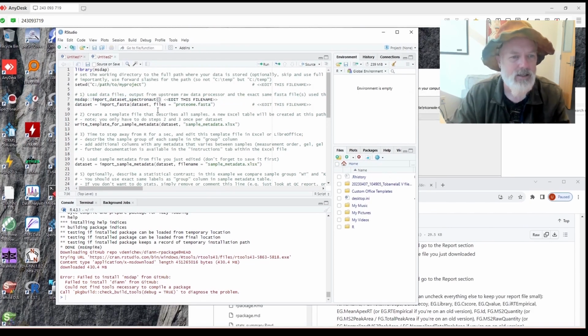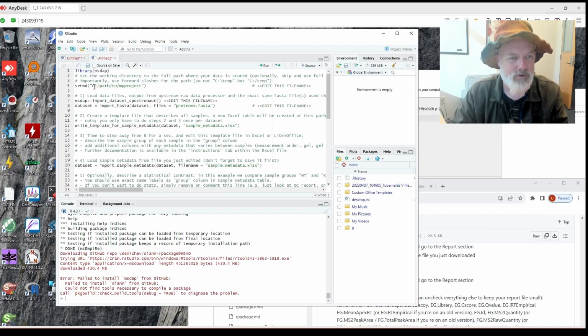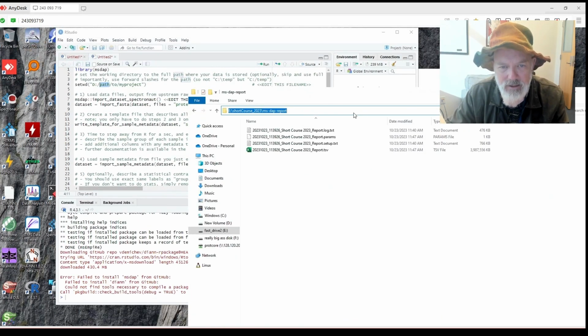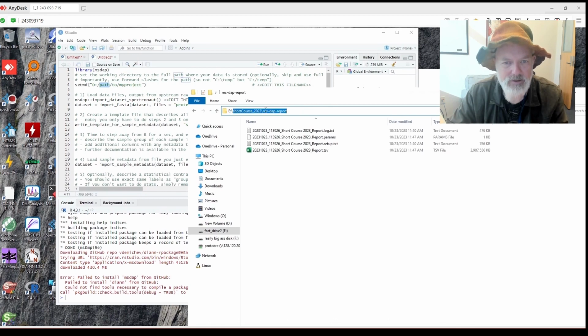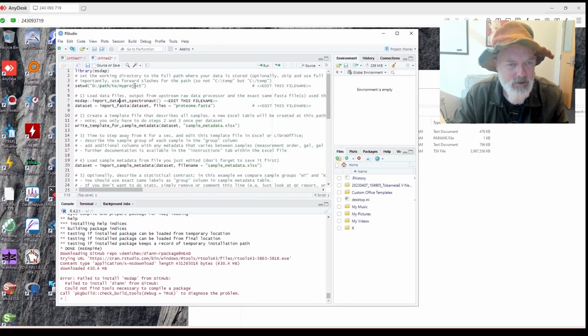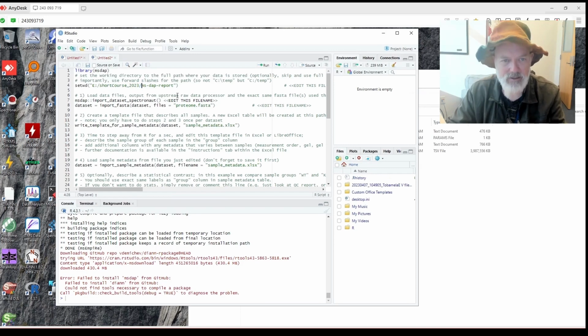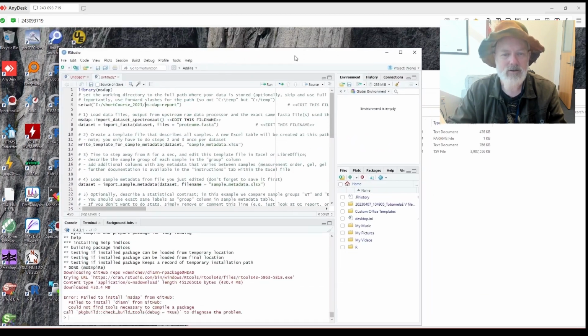All right. That looks like that will work. We have to set up our working directory. I think it's on, where is it? It is on E. So what I like to do is copy this. And remember in R, you can either put an extra forward slash, or is this a reverse slash, forward slash? Anyway, that should work. Or in R, you can do it the other direct way. So either way works, I think. So we'll do that. Okay, and let's see how RTools is working.